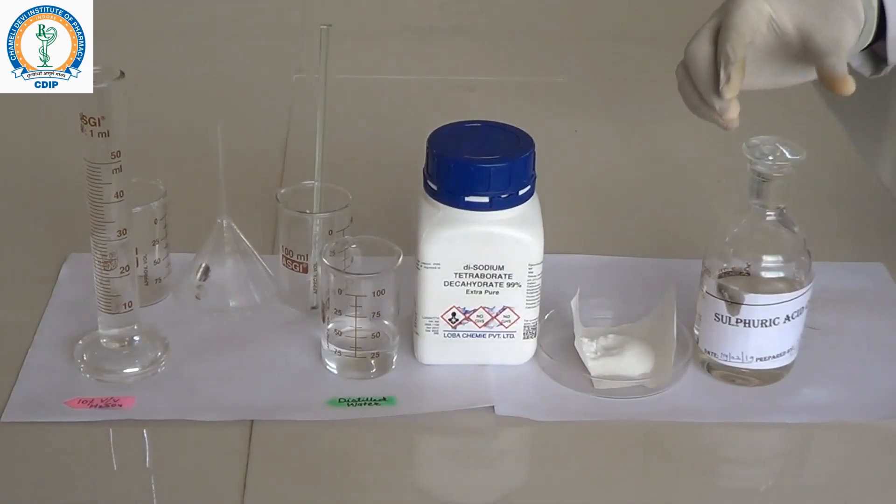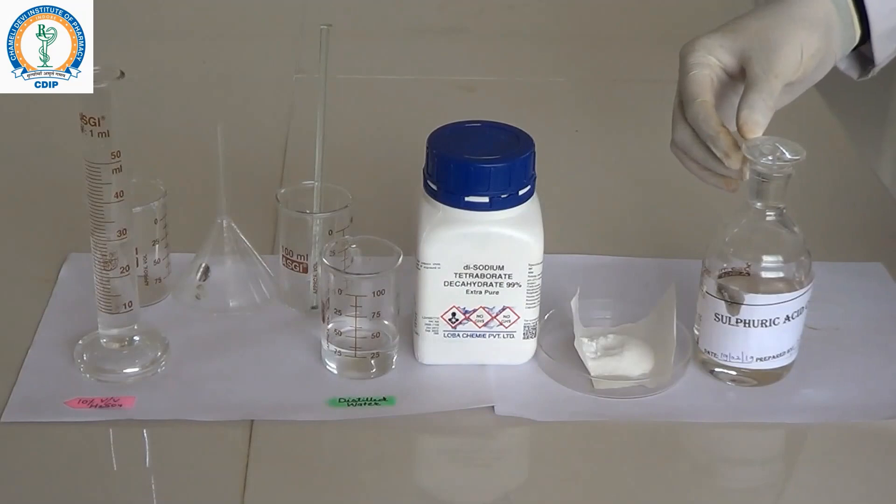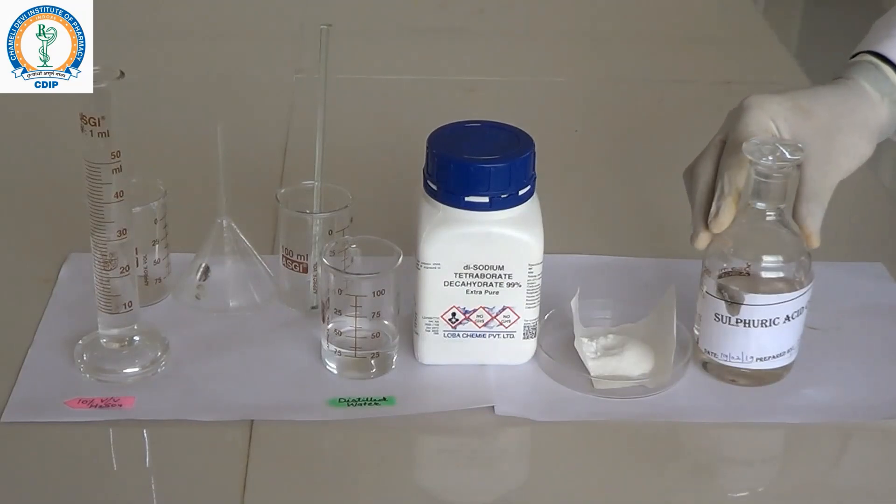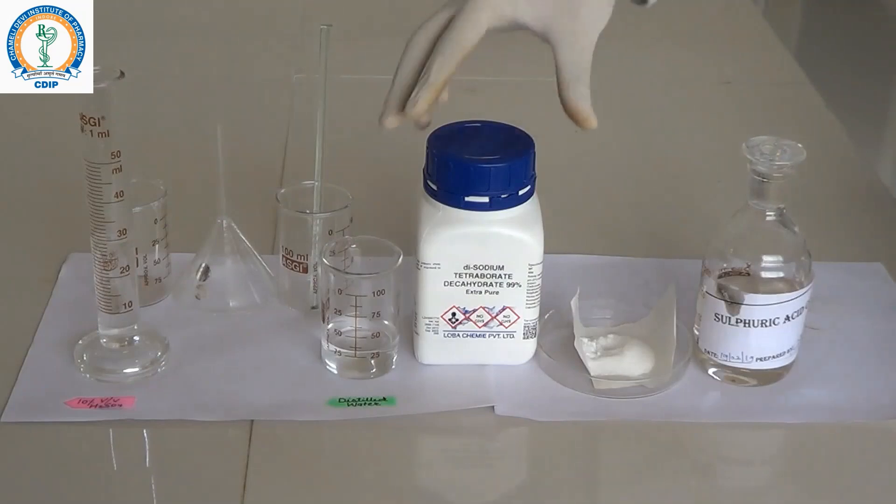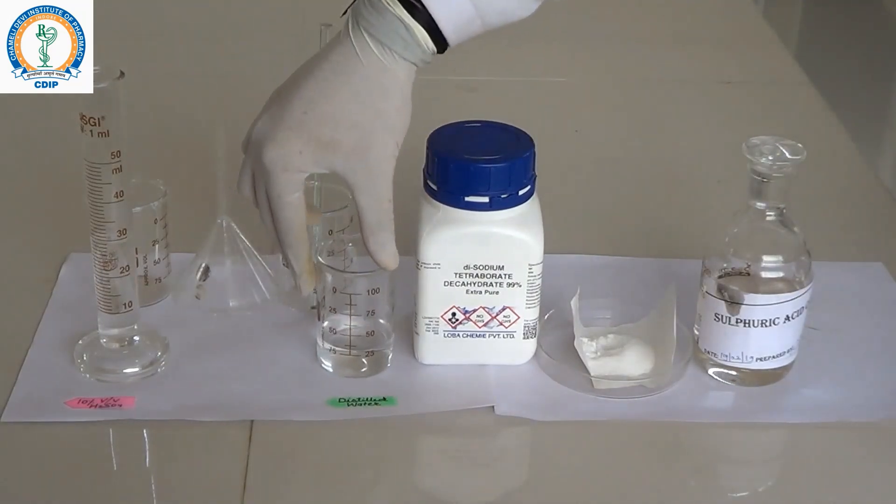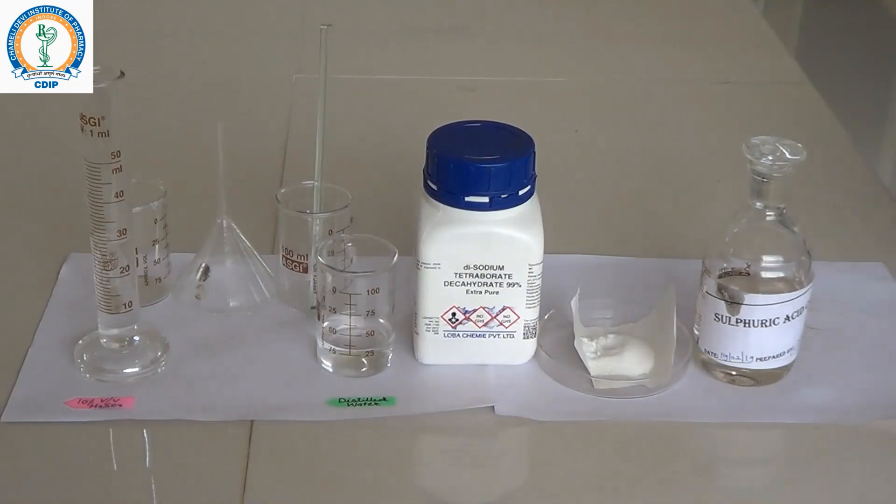Hello friends, welcome to the YouTube channel of Chameli Devi Institute of Pharmacy Indore. Today we are going to discuss how to prepare boric acid from borax. For this we require sulphuric acid, borax, distilled water, and glassware.